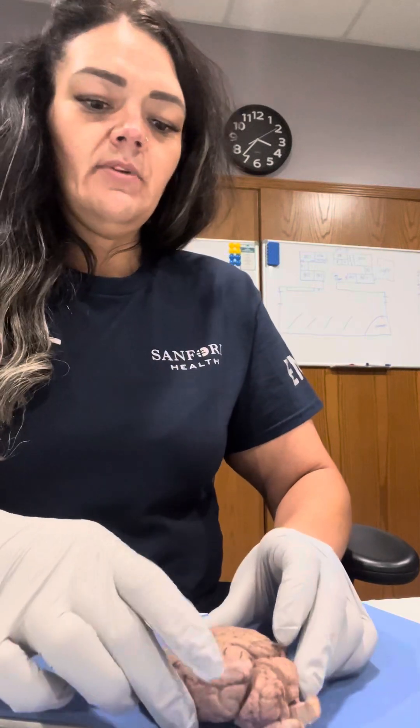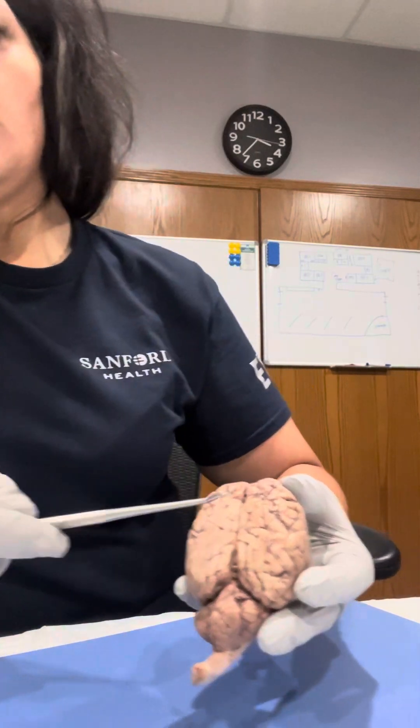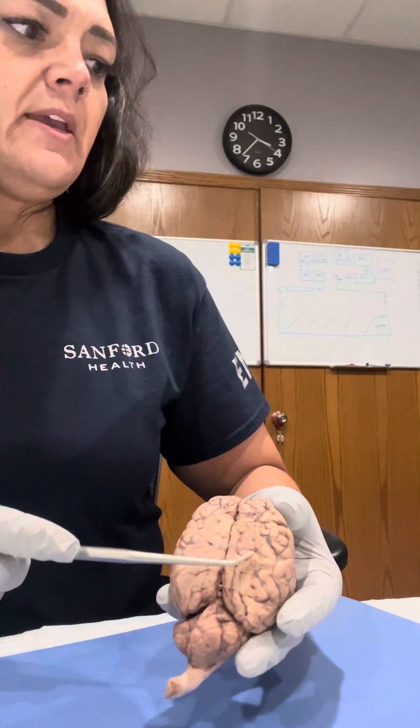My name is Ashley Turner and this is my sheep brain dissection for Biology 220. When I received the sheep brain it looked like this. The dura mater was removed, the arachnoid mater was also removed, and the pia mater is still intact here.